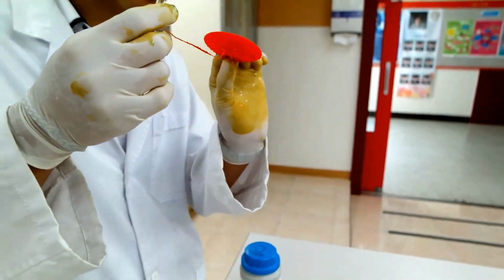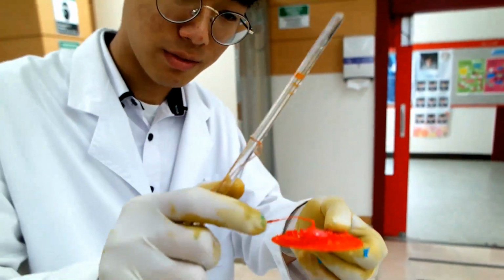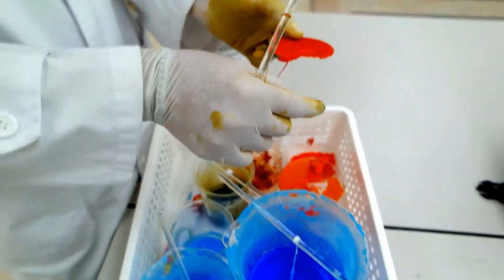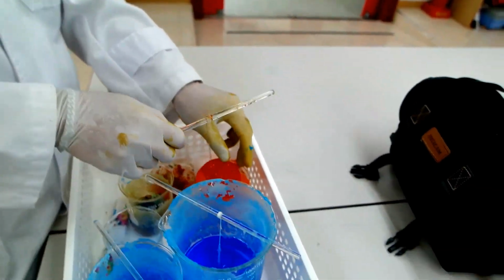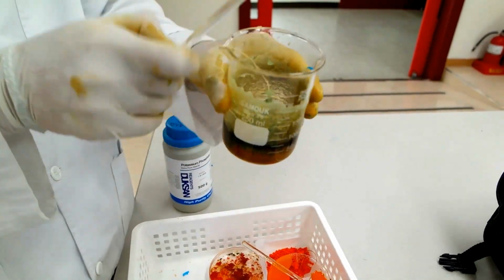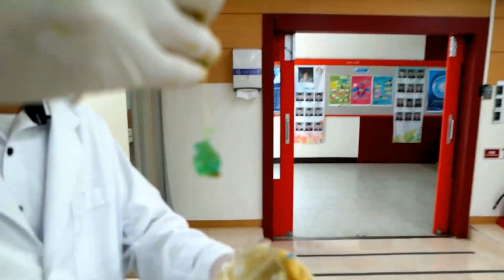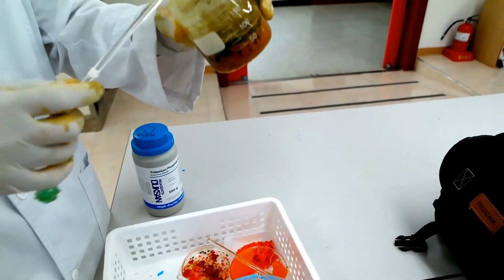Crazy. Guys, if you're making something, make sure you have a new solution every time. Can I see the bottom of it? Yeah, sure. Oh, it's slippery. And if you're gonna do a solution, choose something that's not expensive. And also, there was a crystal, not so sure if it is, but as you can see, it got all white.